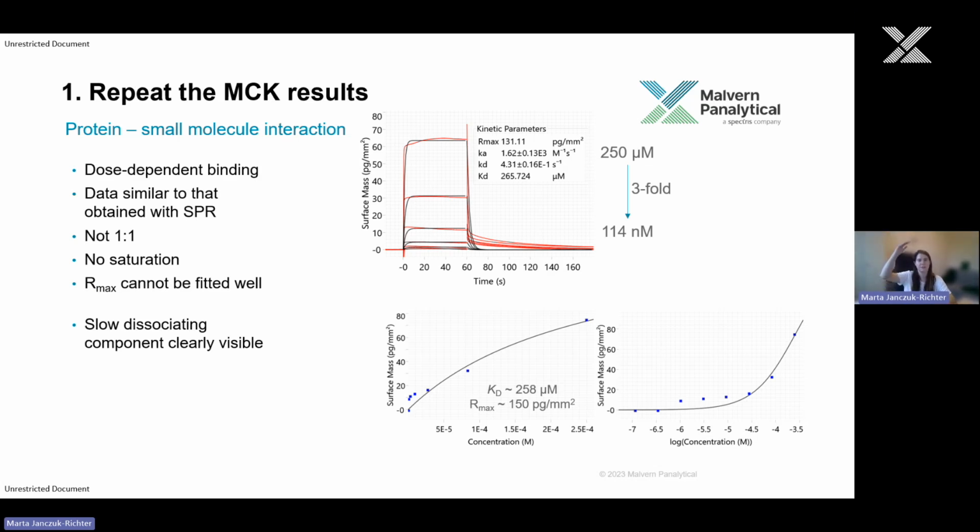So we can see that the distances are getting higher and higher, which you can also see in these equilibrium plots. So it's very difficult for the software to fit Rmax. We really don't know where this curve will plateau. But what we can also see here, it looks like there is some slowly dissociating component visible. So maybe we can use waveRAPID to quickly check if this information will be helpful. Maybe this binding is actually tighter, not that weak.